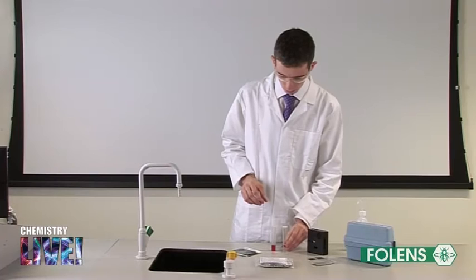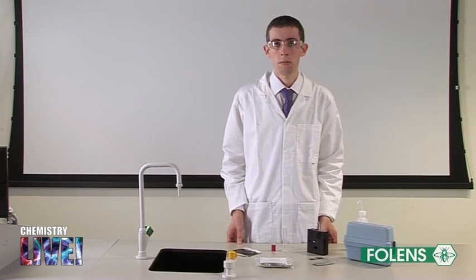This is called the reference tube and its purpose is simply to indicate to us how much light will be absorbed by this depth of water.